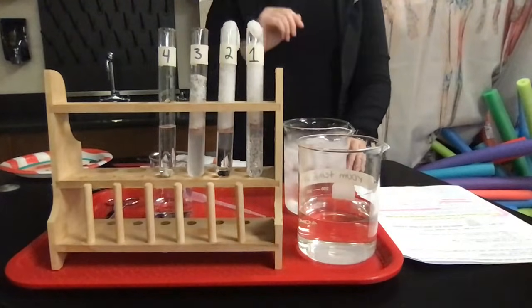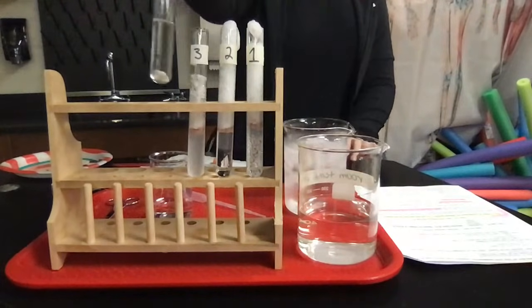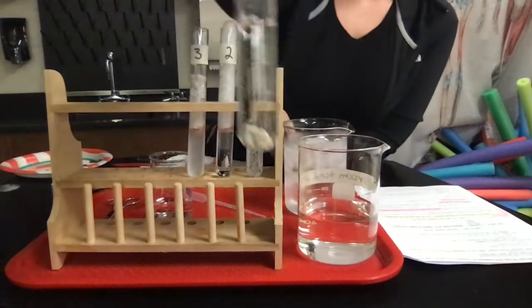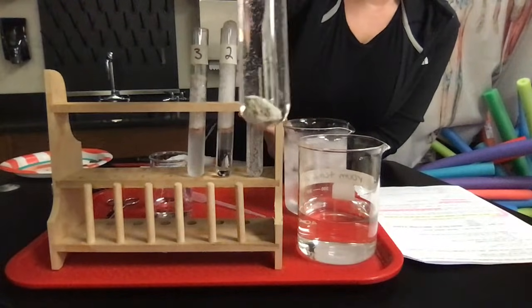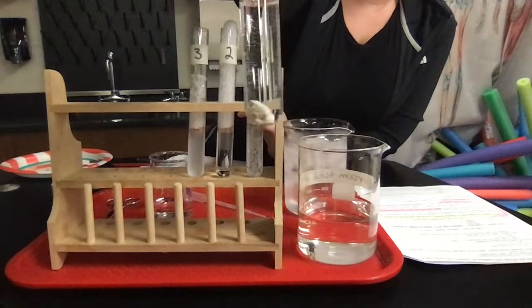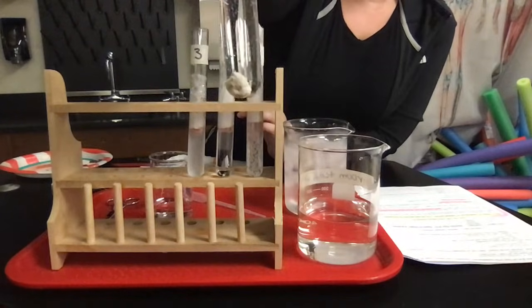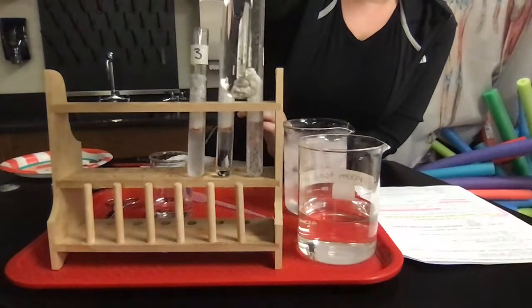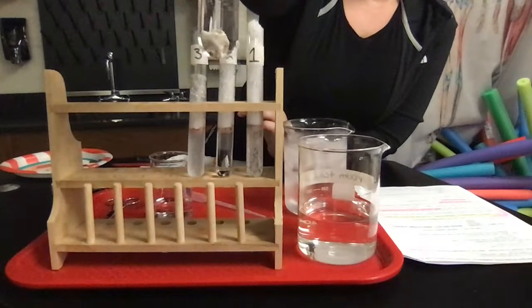Okay, and then with 4, we have a couple of bubbles, which you wouldn't really expect, but a possible source of this could be that you're using a piece of boiled liver, right? It's definitely cooked on the outside, but did I cut it open? No. So could it potentially still be a little bit raw on the inside? Yes. And this is a liquid, which means it's going to go in and fill in any gaps that are present. So if there are any gaps in this little chunky piece of liver, the liquid can get in there and cause a slight reaction.